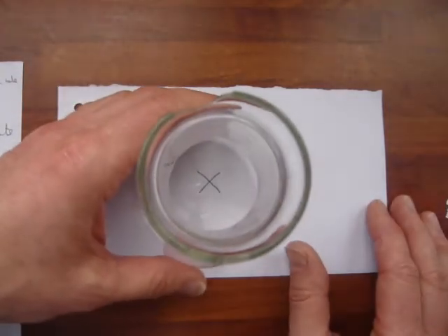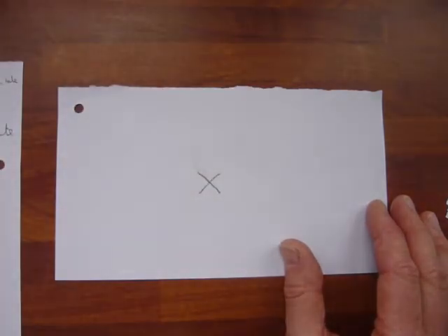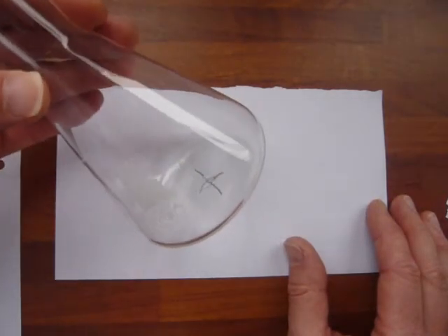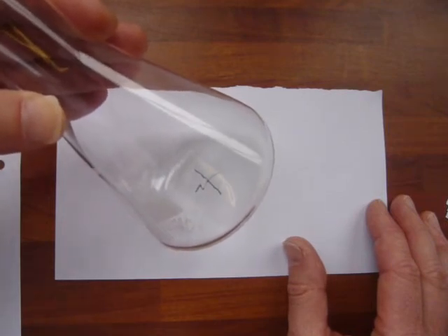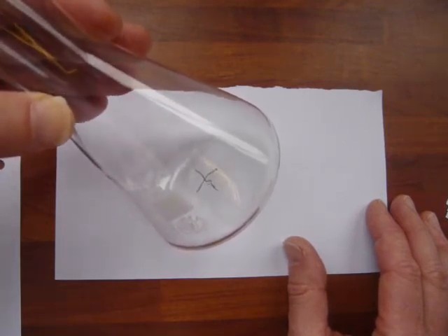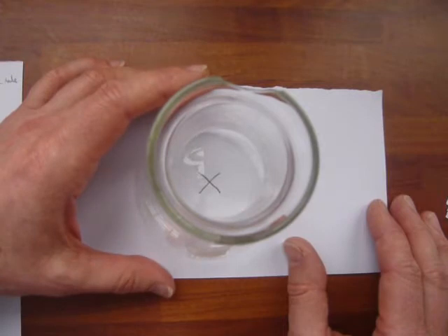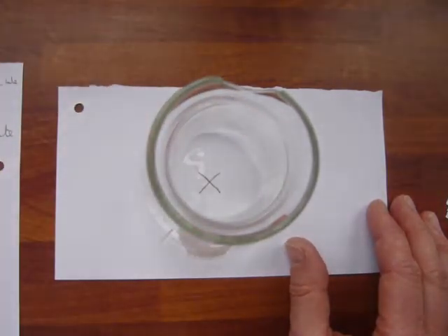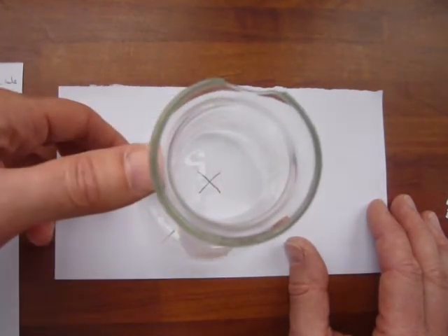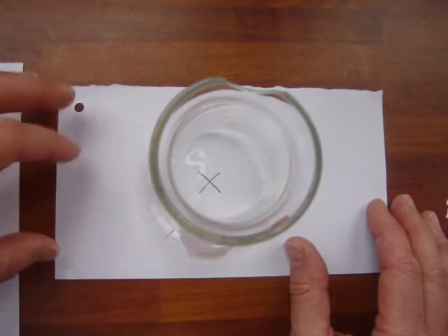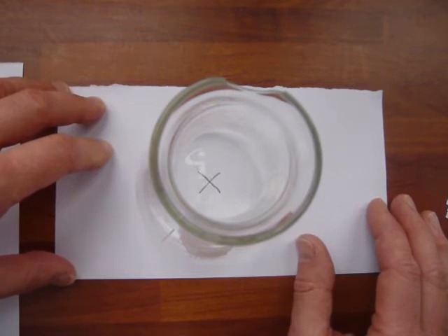There are a few other things that are unique to this experiment. For example, the cross. If you chose a much thicker, bolder cross, it would be easier to see it. So you do need to use the same cross each time. Another thing is the shape of the container. This is about the only experiment you'll ever come across where the shape of the container is important. If I choose a very wide container, then the depth of liquid I have will be very low. Whereas if I chose a narrower container, like a beaker or a smaller beaker, the depth of liquid would be higher, and that would cause my cross to disappear more quickly. The choice of apparatus in this experiment alone is important.